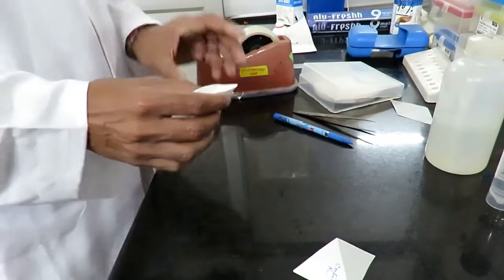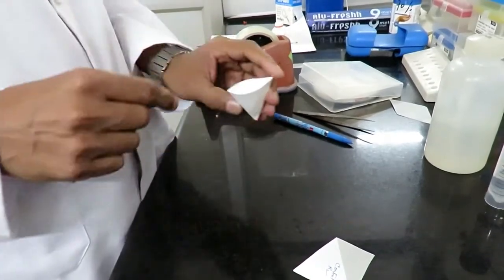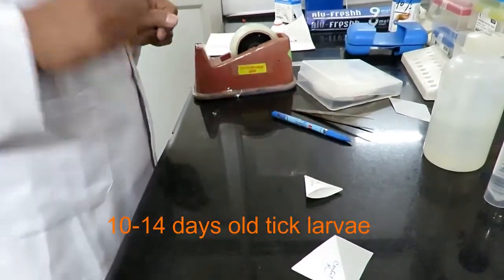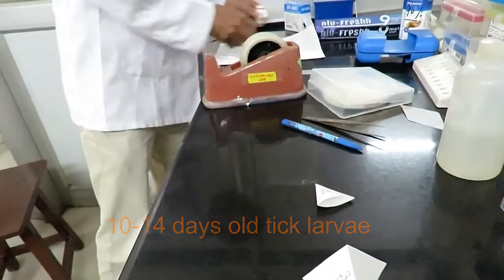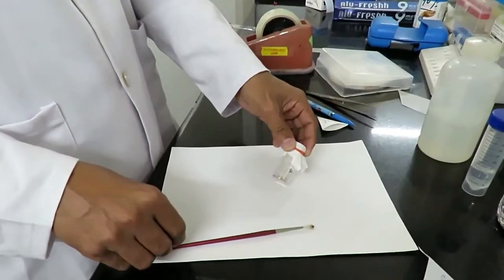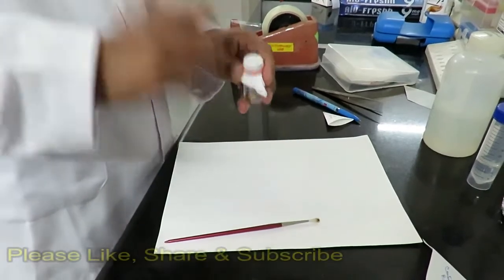One side is open of this packet and from here we insert the larvae into the packet. For this purpose, 10 to 14 days old tick larvae are standard for testing this drug.